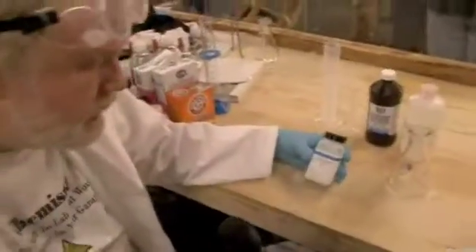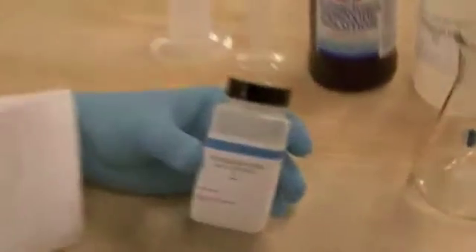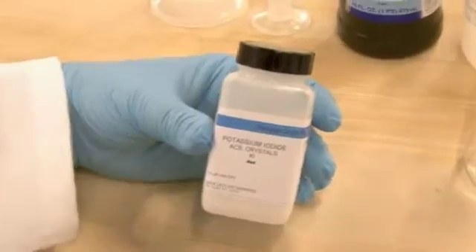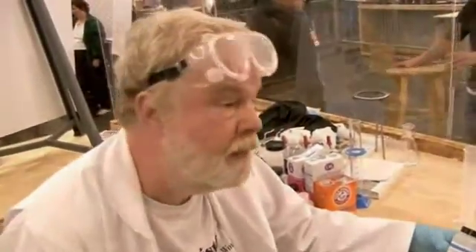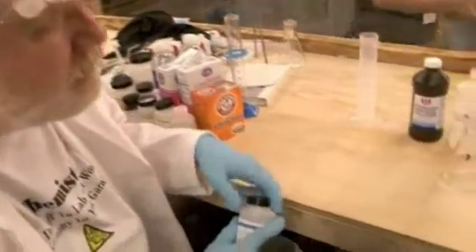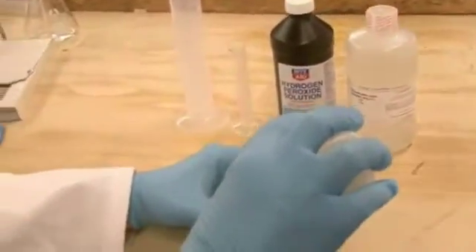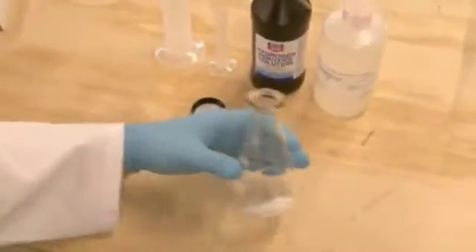To show the futility of the kind of attempts that the DEA does to control chemicals, what I'm going to do right now with Phil is show you how in about two minutes with some really readily available stuff, you can make your own iodine. What we have here is called potassium iodide. It is basically an uncontrolled chemical. I could order a ton of this stuff, literally have it delivered to my house, and the only one that would raise their eyebrows would be my wife. There's just no paperwork to be done on it or anything. What I'm going to do is dissolve a little bit of this potassium iodide — ordinarily working in the lab I would weigh it out, but I'm just going to eyeball it right here.